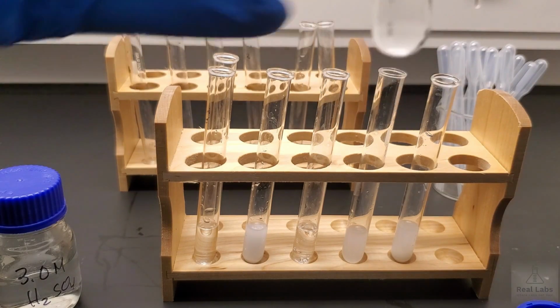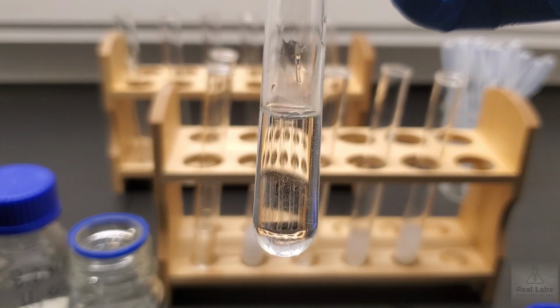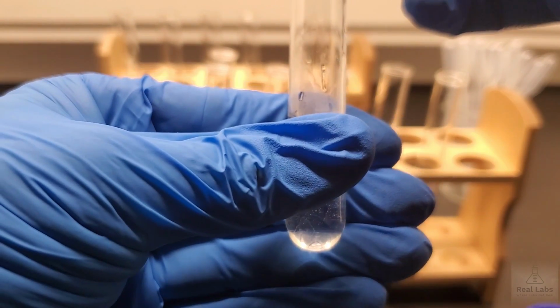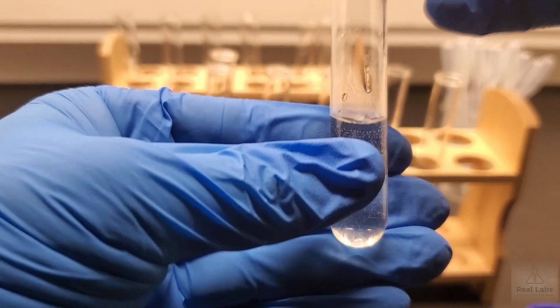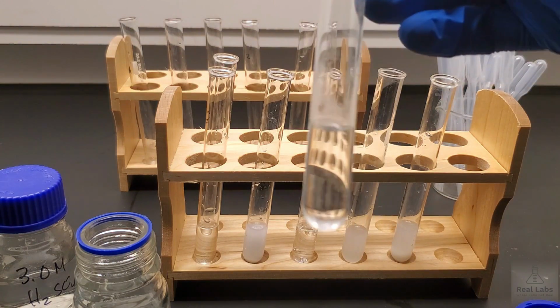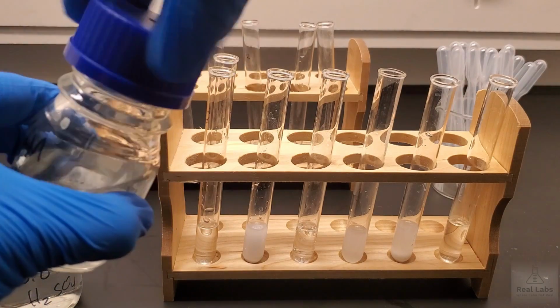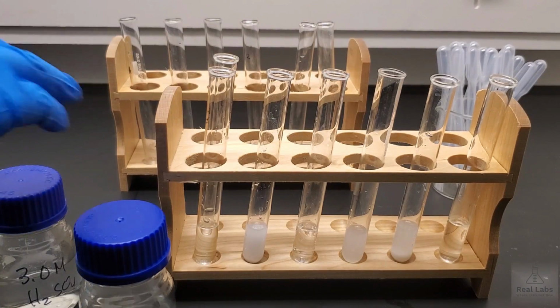It's a little bit hard to see, but if you look very carefully, you can see some very tiny bubbles forming in that vessel. Those are not mixing bubbles, those are actually generated by the addition of those two chemicals. And the temperature of this system is definitely above room temperature. I would say it feels like about 10-15 degrees above room temperature, maybe even a little bit warmer than that. So a definite reaction occurred in that system. Like I said, note that there are actually bubbles generated, so that should tell you what happened during that reaction. And now we're going to put the sulfuric acid and the ammonium hydroxide away.